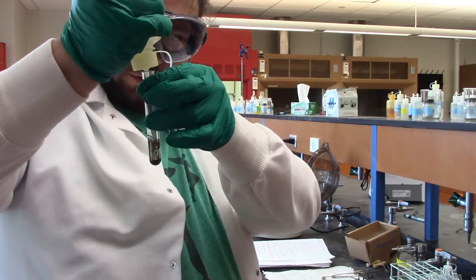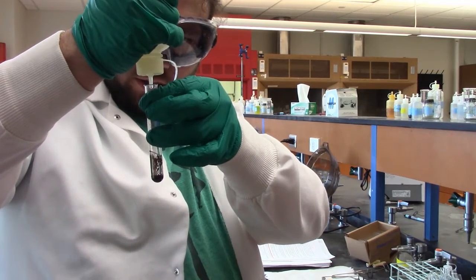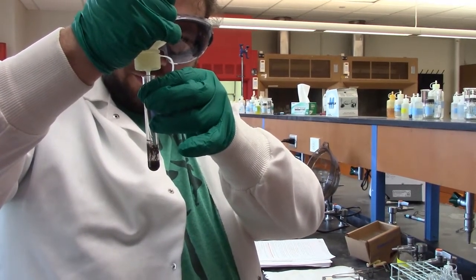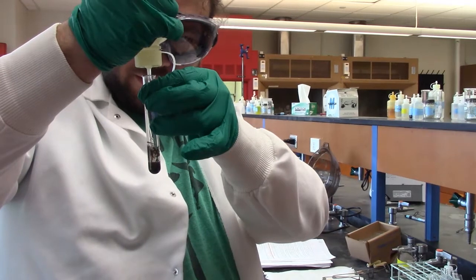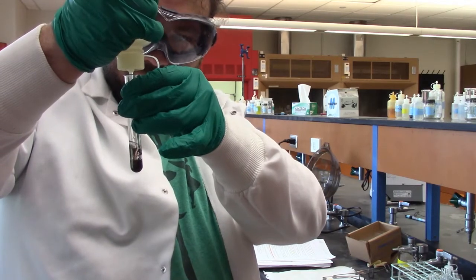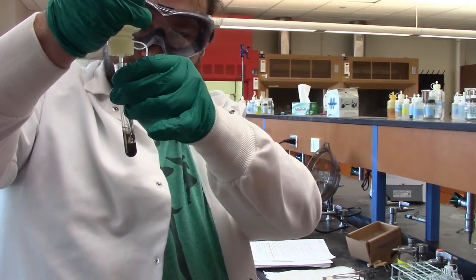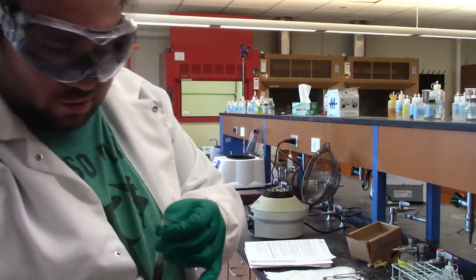Now this bottle is hard to squeeze. 3. On the bright side, this is easier to count than the last one. Yeah, some of our bottles are getting a little old. How many have we made it to? This is 18. We're almost there. 19. 20.